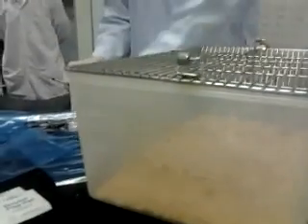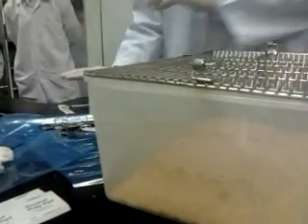Since I did not pierce into any vial, the needle is sharp. I place it on top, maybe on certain needles there, so I don't get blunt. Now I'm going to catch a mouse.